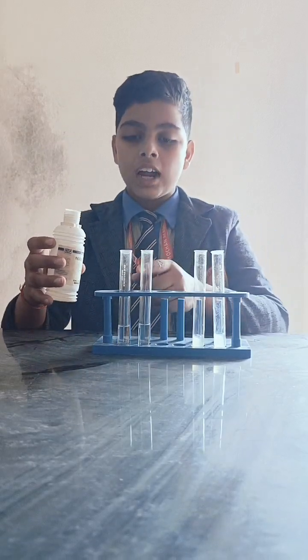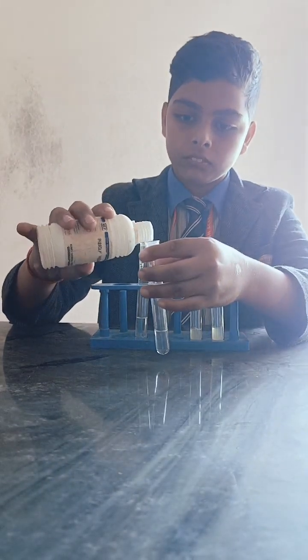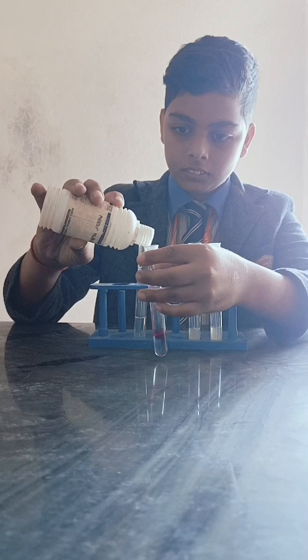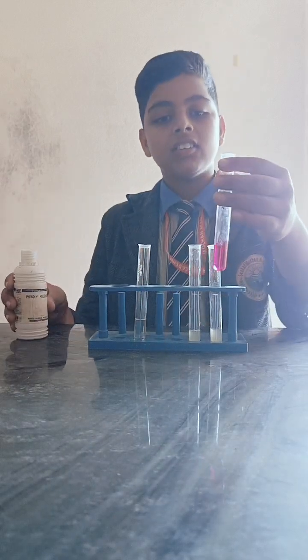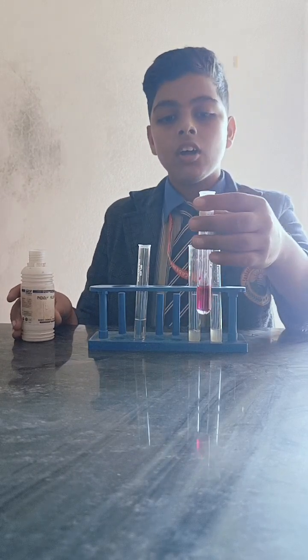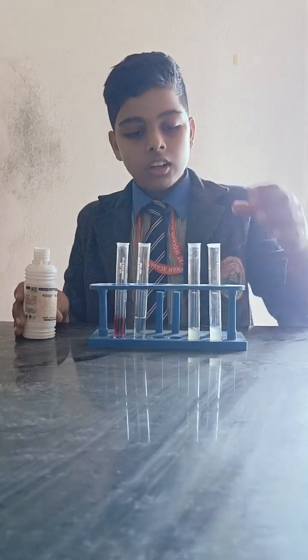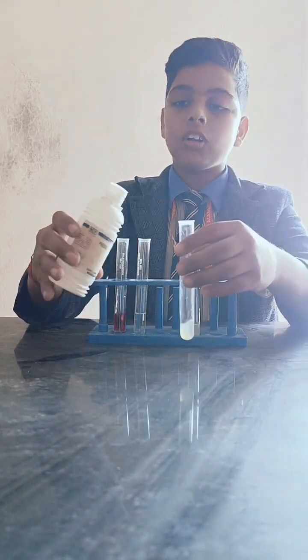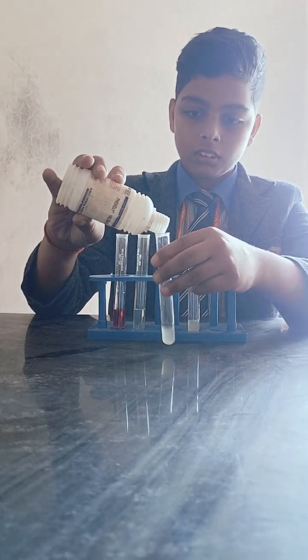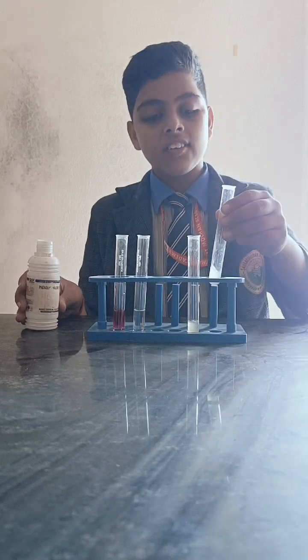So I am going to add phenolphthalein in this test tube. It's changed to pink color, so it is a basic solution. And if we talk about this solution, it does not change any color, which means it is an acidic solution.